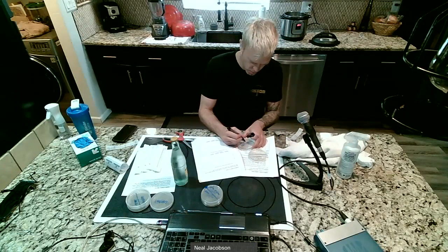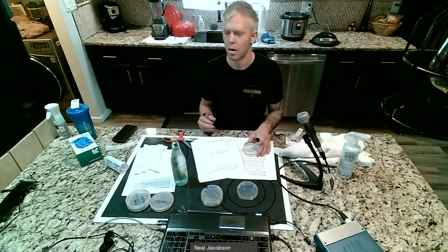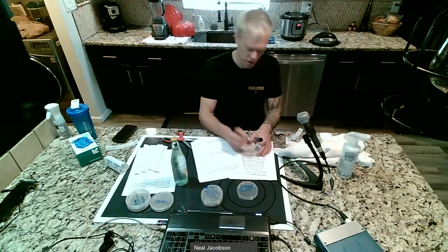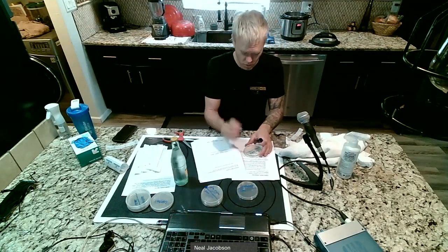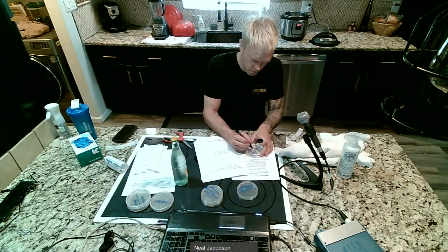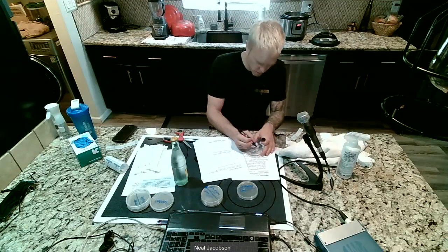But you could do anything that's not living. So cell phone, TV remote. My other 2 inanimate objects will be something similar. So I'll say like piano keys. That's a good one. So I'll do piano keys because I got a piano over there. And then I'll do my keyboard, like my keyboard on my computer. Oops, keyboard.